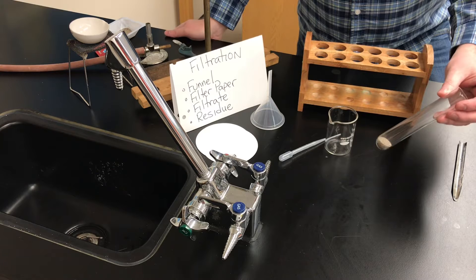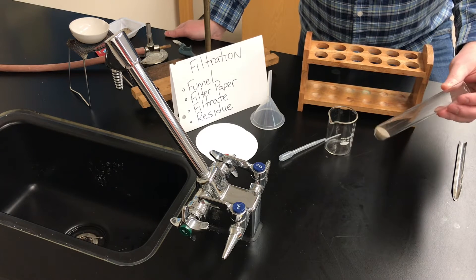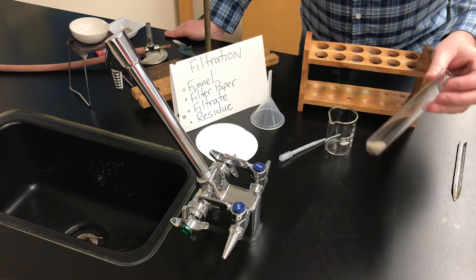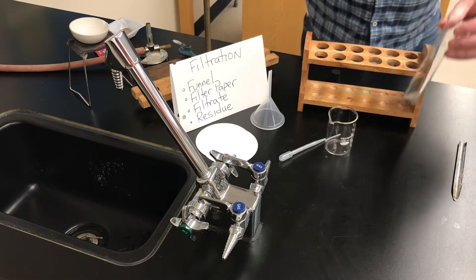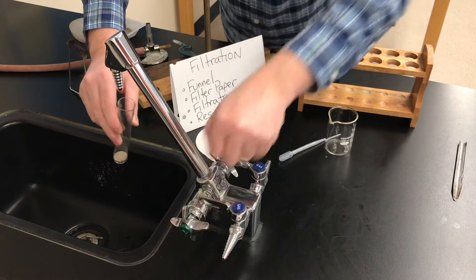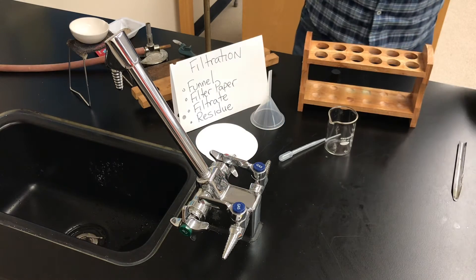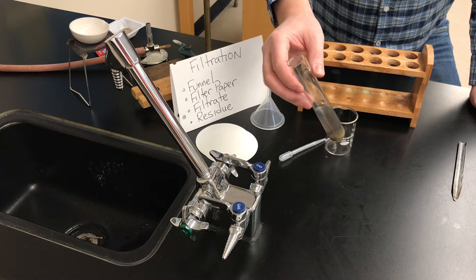I know that charcoal and sand are insoluble in water and insoluble in alcohol, but I do know that table salt is soluble in water. So I've decided I'm going to take some water — I've got a faucet here — and add some tap water to the test tube. The exact amount isn't that important, but the more water I add, the more water I'll have to get rid of later.